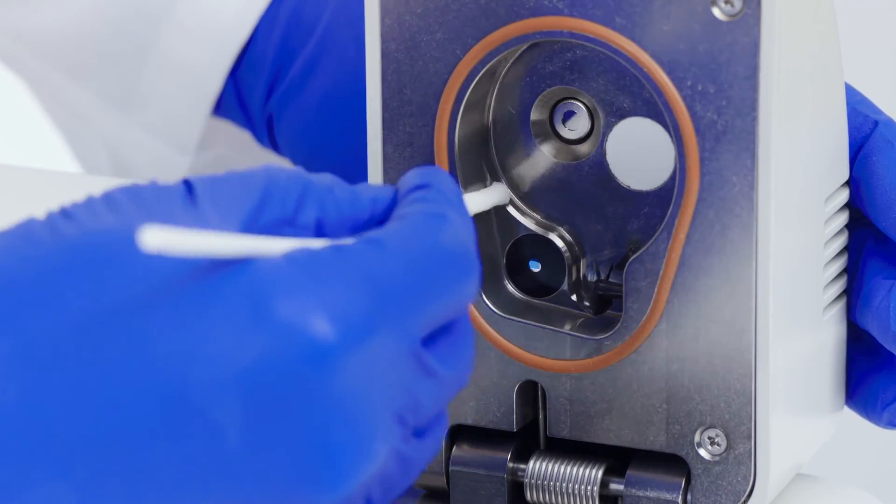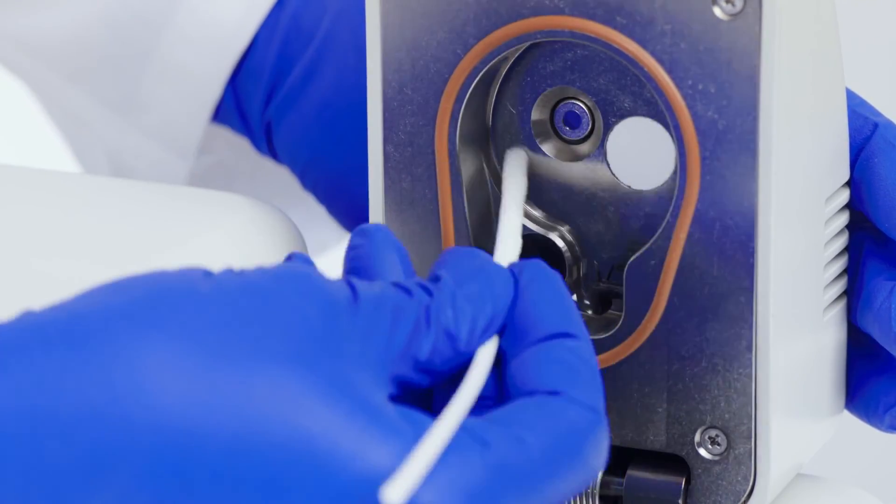Repeating the same clean, rinse, dry process used to clean the sample chamber: wash, rinse, and dry.